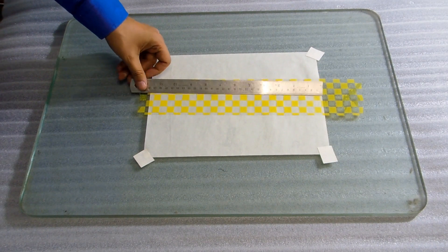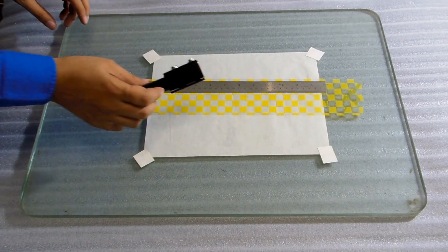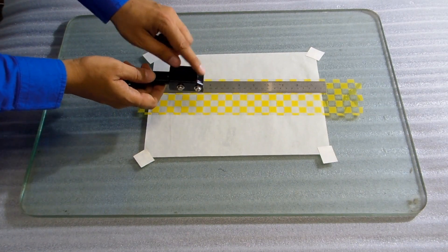Use a stainless steel ruler and special 1 inch double blade cutter to cut the tape as shown in the video.